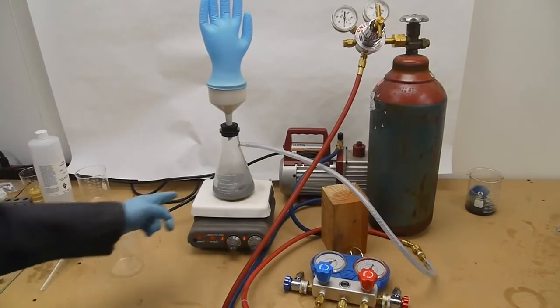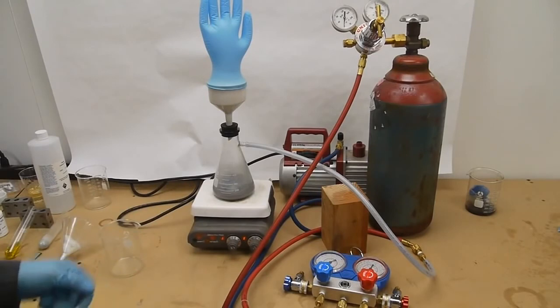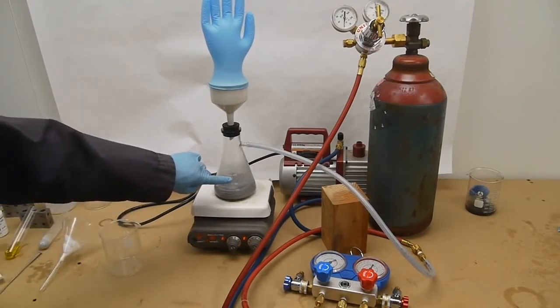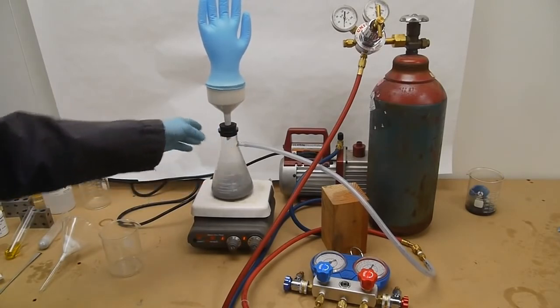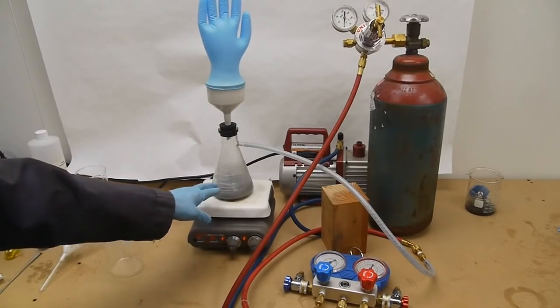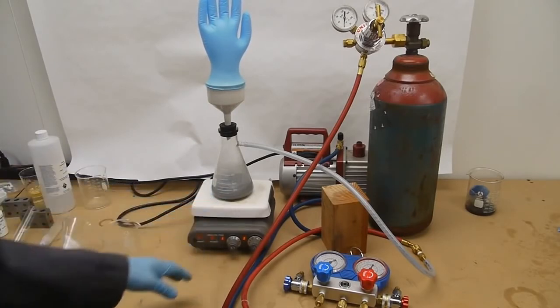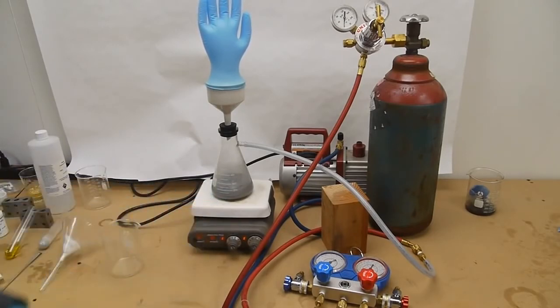As you can see, the palladium has assisted the fatty acids in absorbing the hydrogen gas that we pumped in. You can even see that the solid form—the hydrogenated saturated form of the fatty acids—is coating the inside of the flask. So now the job is to filter out the catalyst as well as possible and see what kind of product we have.